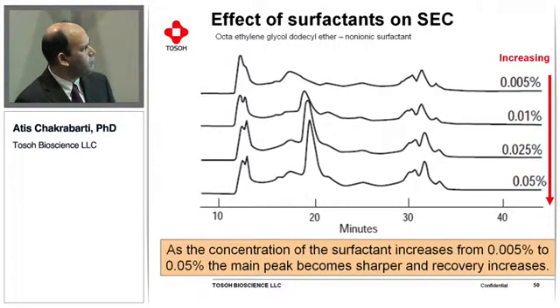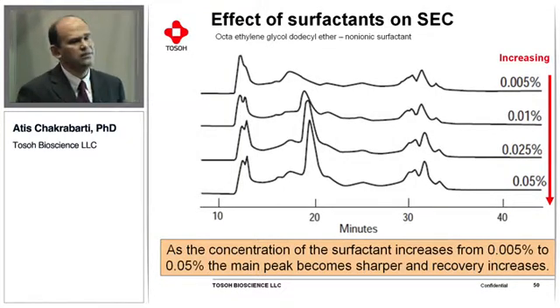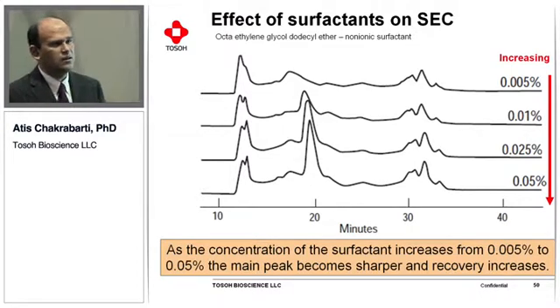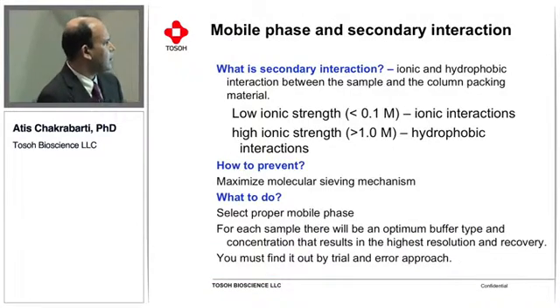As you see here, in this case the effect of the surfactant is also shown, from 0.005%, and here in this case 0.05%. We have used a non-ionic surfactant to show that it helps in getting better peak shape, resolution, and also recovery.